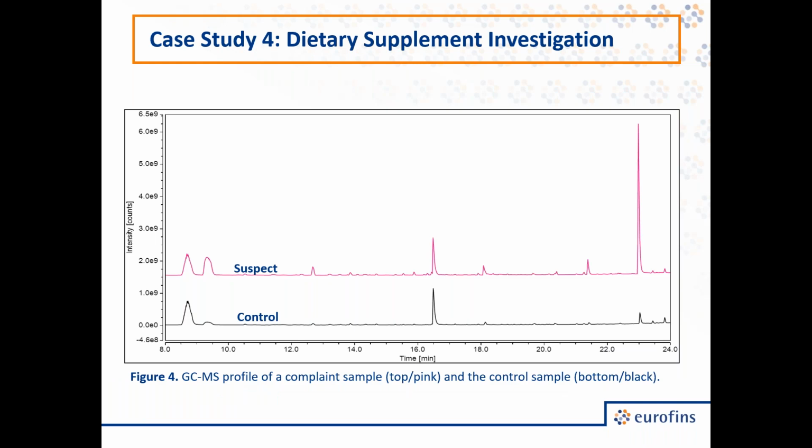So here on this slide, on the bottom, I have the volatile profile of the control sample in black, and on the top, we have the suspect sample in pink. And we noticed a number of key things. For one, we were able to identify a number of compounds that were present in the suspect sample and not found in the control, such as 1-pentanol, propanoic acid, and pentanoic acid. In addition, we saw elevated levels of other compounds, namely hexanoic acid and hexanol.